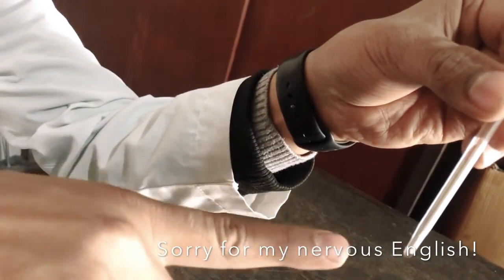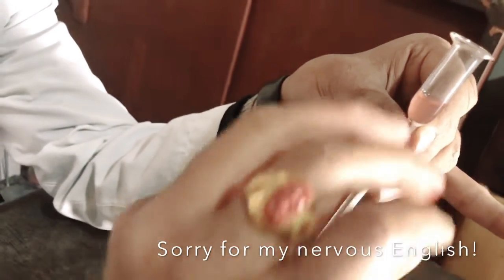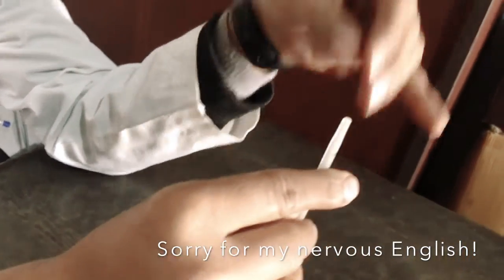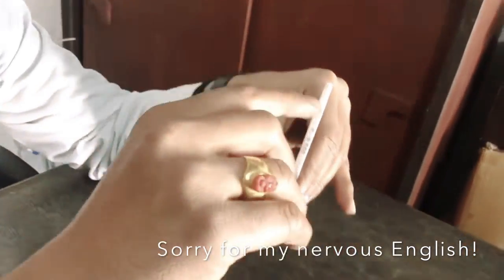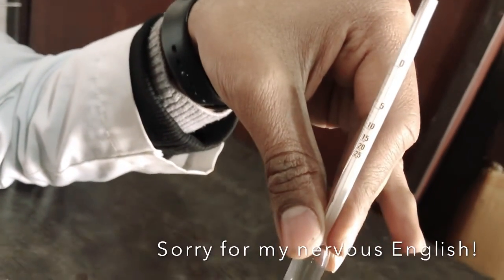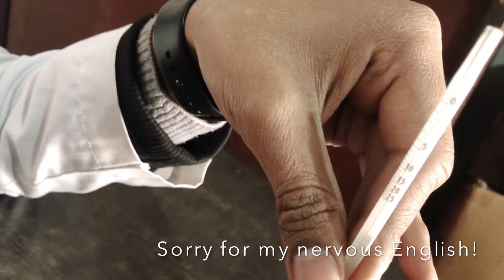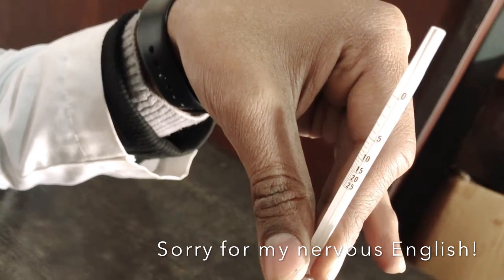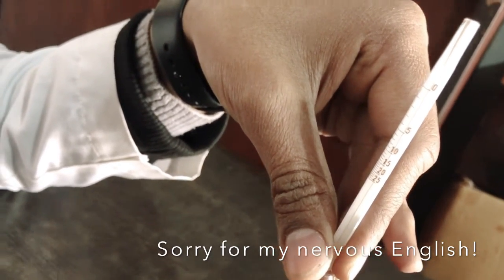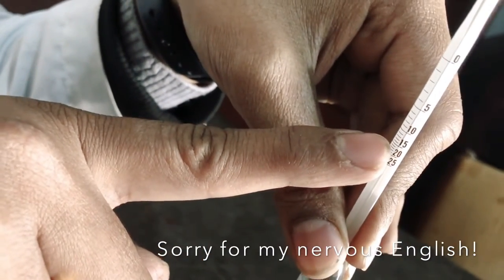It flows from down to upward, this way. And once it flows, we make it upright in position like this. Then here we get the reading — it goes like this. It is reaching 9, 11, 15, 16 percent. The alcohol percentage in this wine is 16 percent.